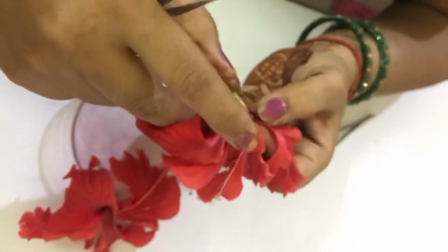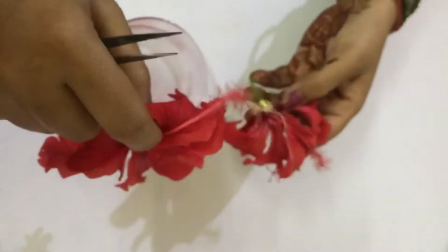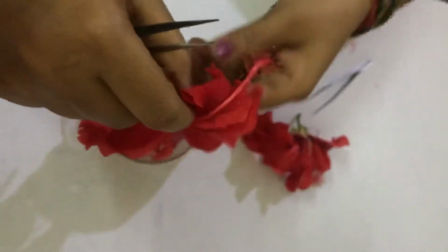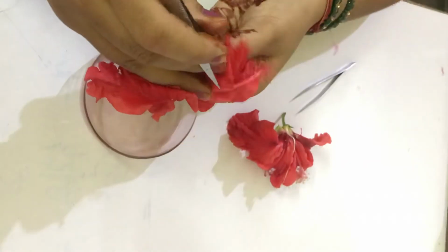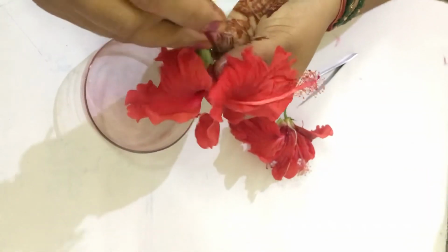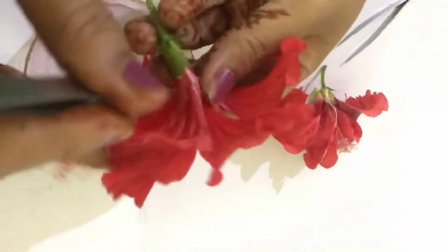Now, about the dissection process. Take a flower and, with the help of a needle or forceps, make a single cut. You have to open the flower only, without disturbing the other floral structures.